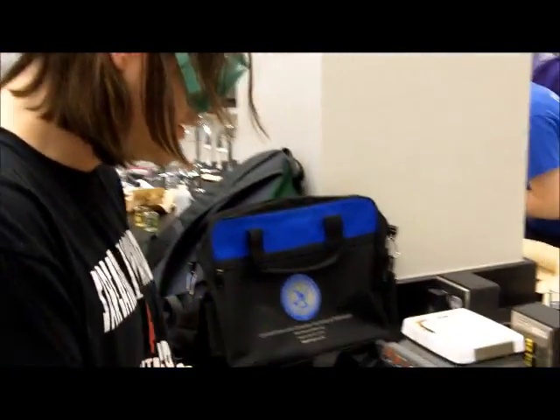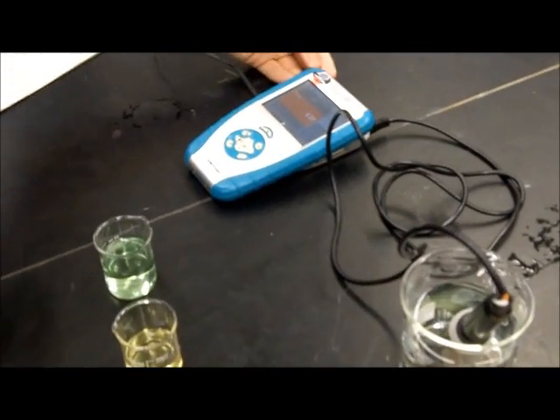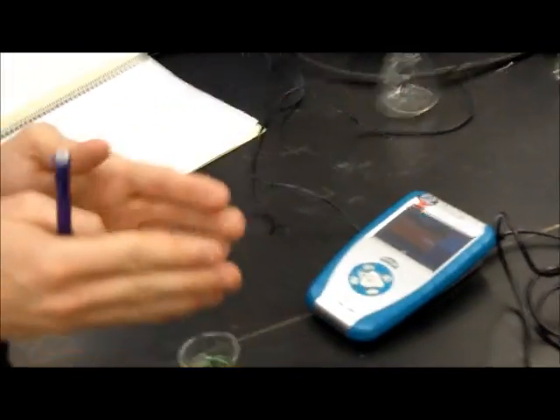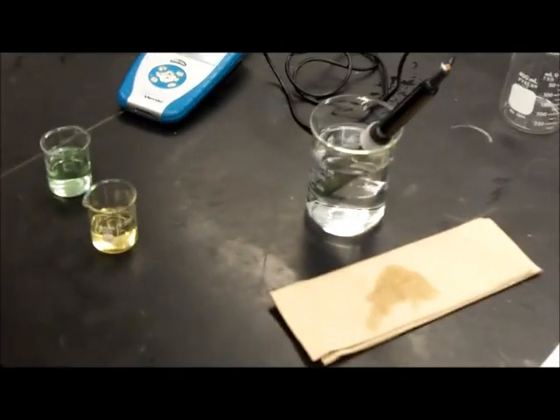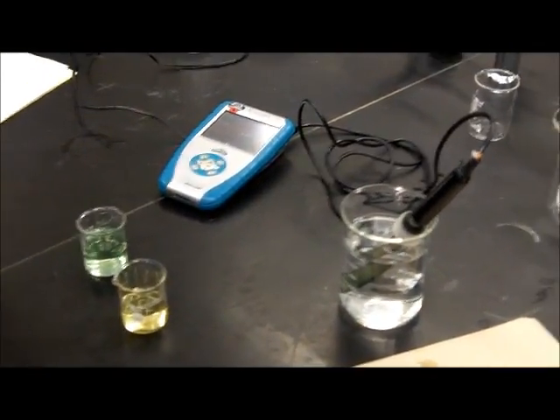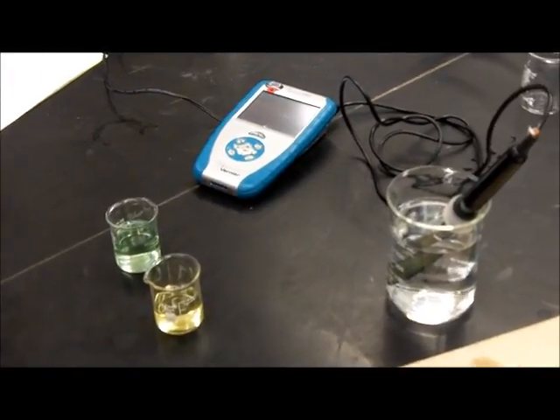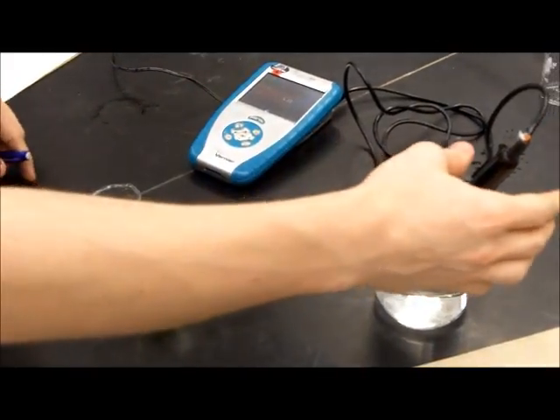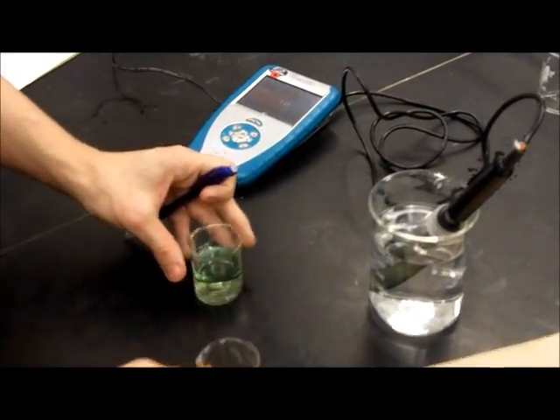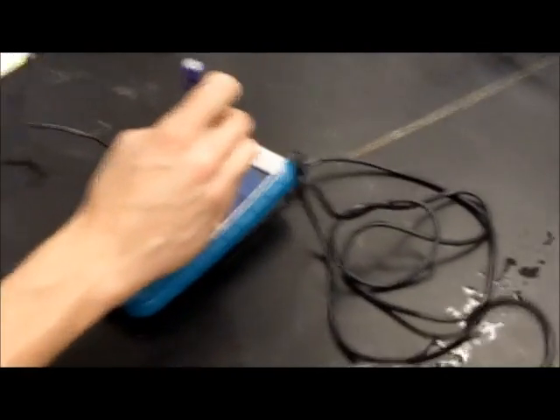We're going to calibrate the pH meter today. First, it obviously has to be on, as you can see. And be sure when not in use that your pH probe here is in distilled water, especially when it's not in use, because we don't want our readings to be inaccurate. So, to calibrate it, first we go to the calibration menu in channel 1, because that's where this is plugged in.